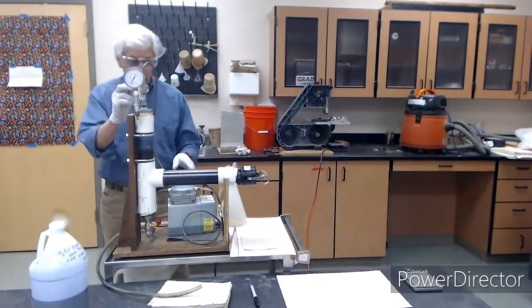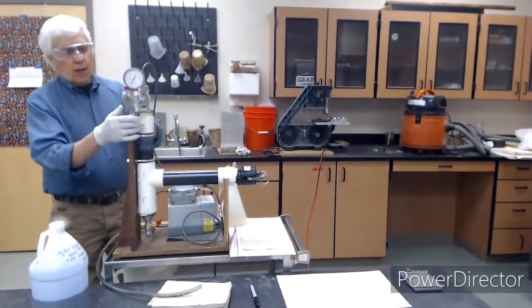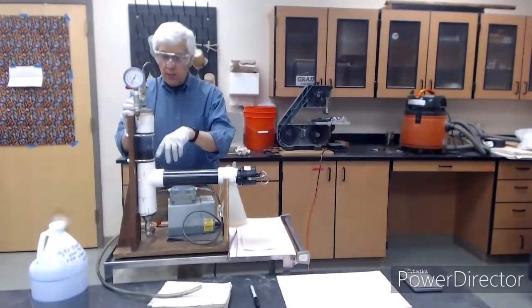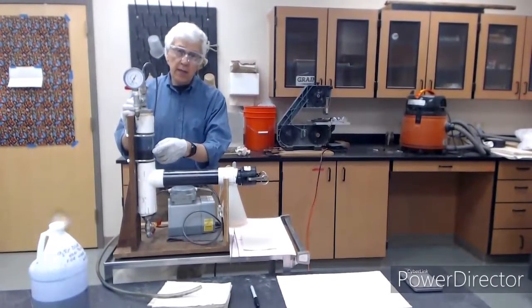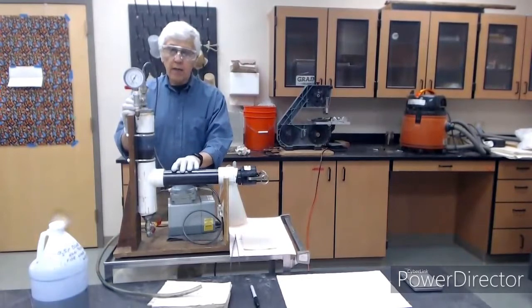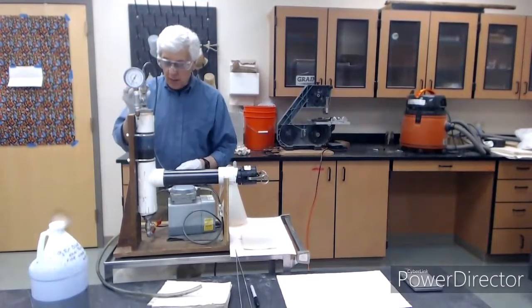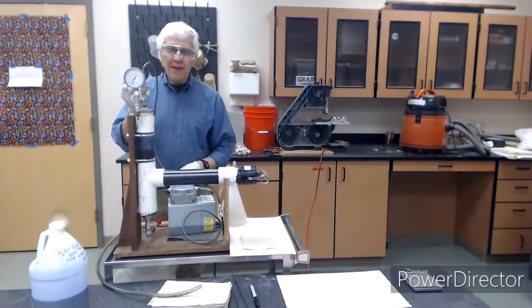Now we're going to have air pressure. The air pressure is coming up to this valve. And this is down. So when we open this valve, we should get air pressure coming in here. And you should be able to see the liquid in the gauge tank drop. And we'll look for that. And again, like I said, we're going to press for 5 minutes. Okay? So this is closed, so it can't get out. And away we go.